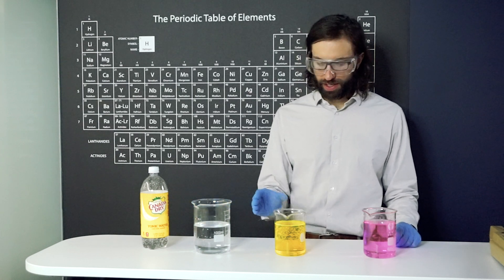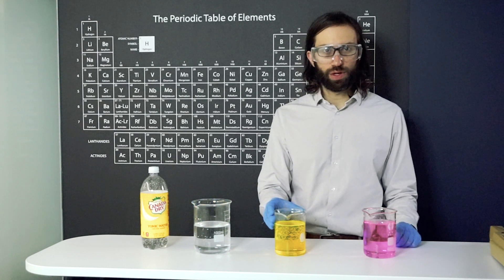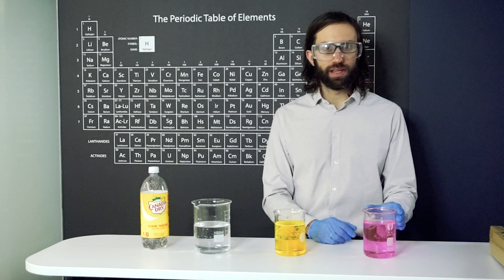This is just tonic water. This is fluorescein, a dye, and this is rhodamine B, also a dye.